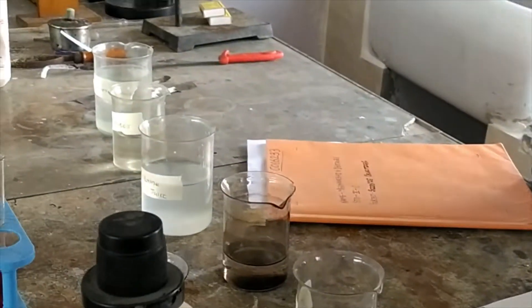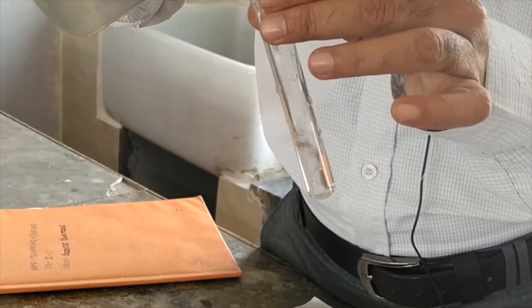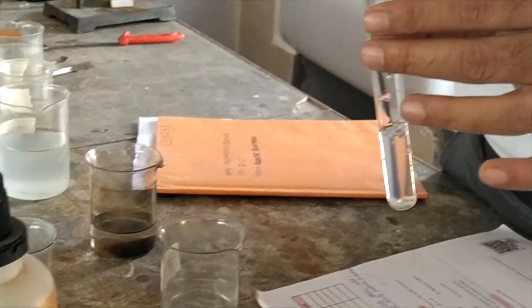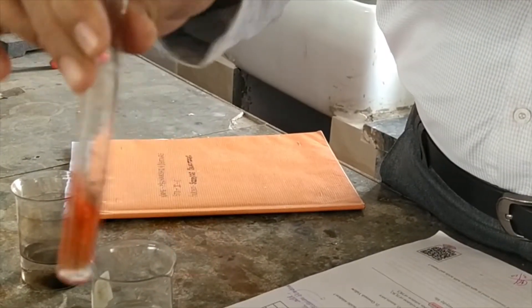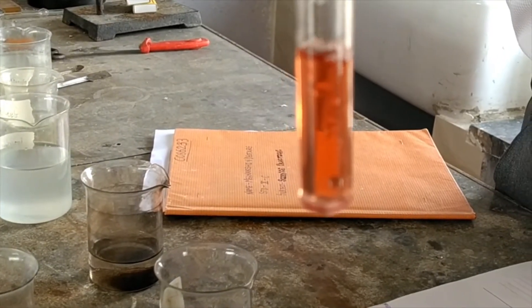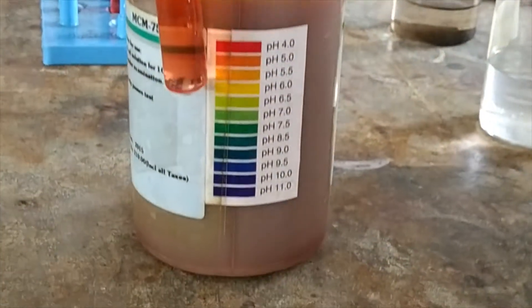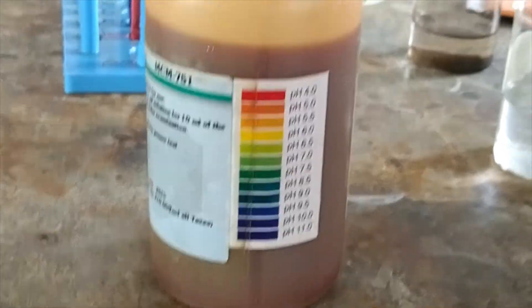Now let us take lime juice. Take 2 or 3 drops of universal indicator and check it well. This is orange in color. Dilute acetic acid is also having the orange color — I will send the PDF and you can note it down. The orange color means the pH is 5, so this is again acidic.